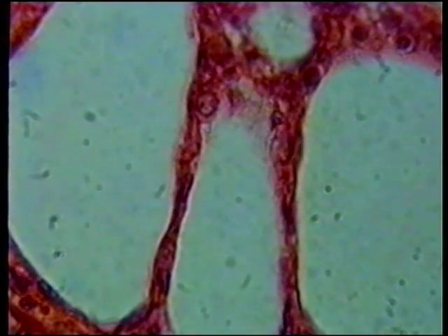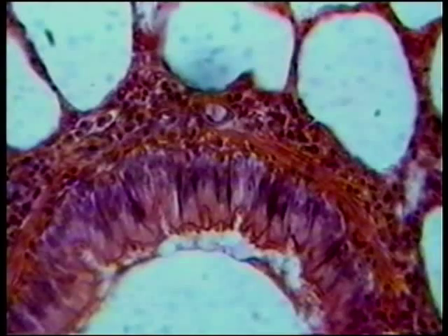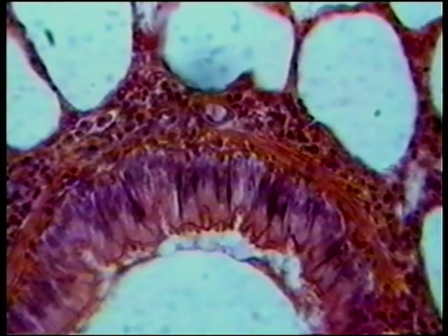Notice these rings of tissue are different sizes. This is what we would expect if lung tissue is composed of hollow spheres — a thin slice will generate rings of different sizes. So here again we see a relation between the organization of lung cells and their function: lung tissue is composed of cells arranged in hollow spheres, and that promotes the exchange of gases, oxygen for carbon dioxide.